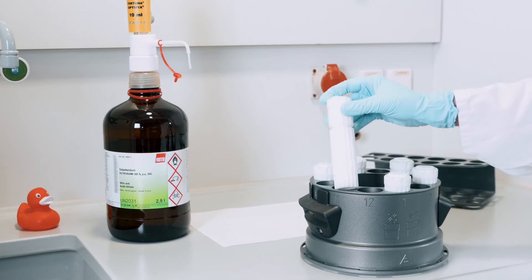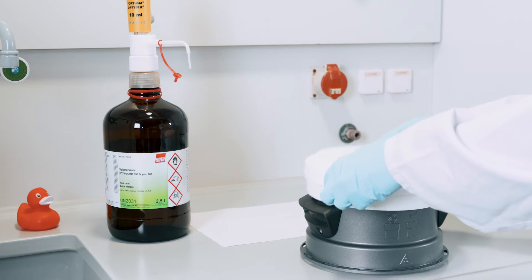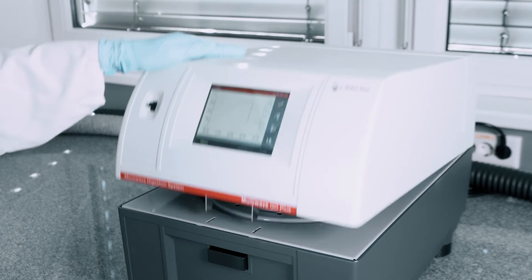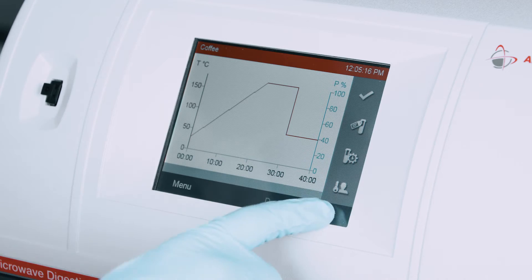The vessel is located directly above the temperature sensor for perfect reaction control. We close the lid and start the method. The most recent method appears automatically.